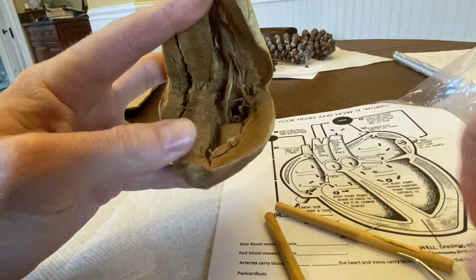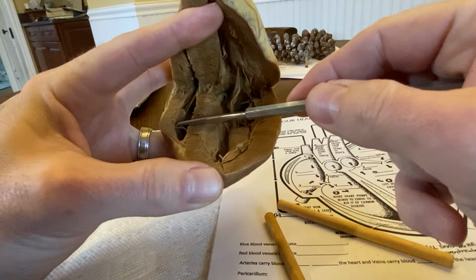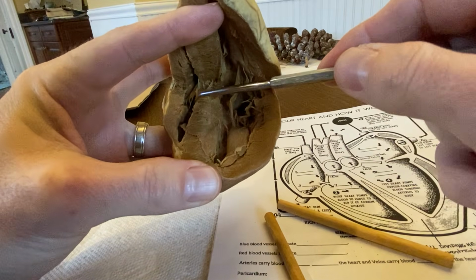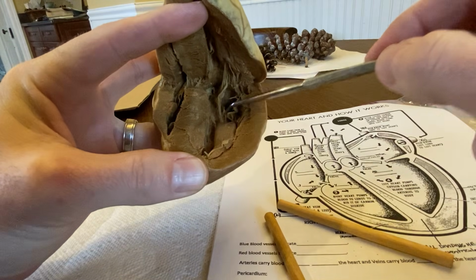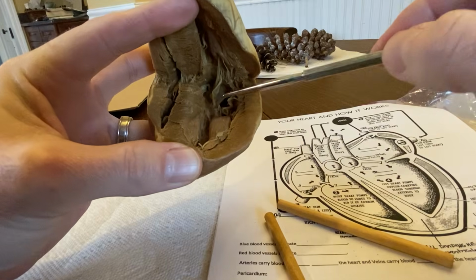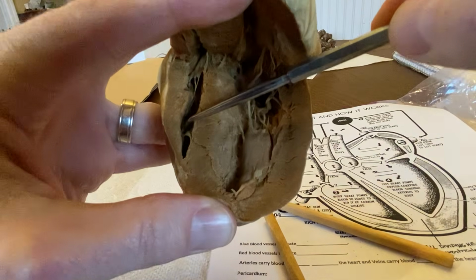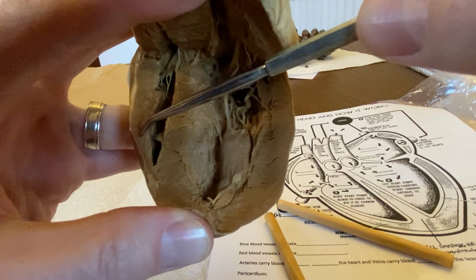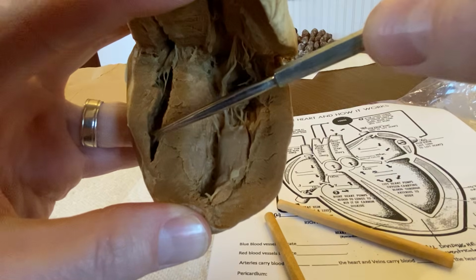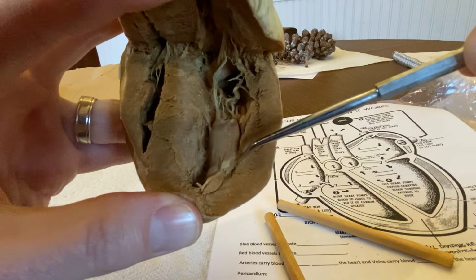So on the inside, pieces that you should see, we have the two chambers, right? This opening here on this side is going to be the right ventricle, and here's the left ventricle on this side. And you'll notice that the difference in the thickness of the wall is pretty dramatic. So if I pull this closer here, notice how this is reasonably thin over here on this right ventricle, okay, versus this being much, much thicker over on this side, on the left ventricle.